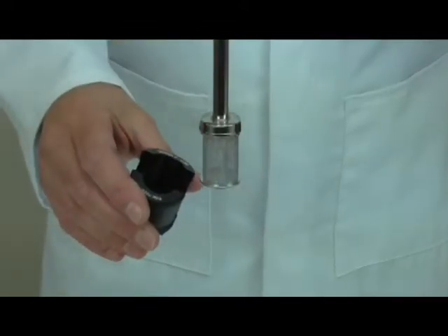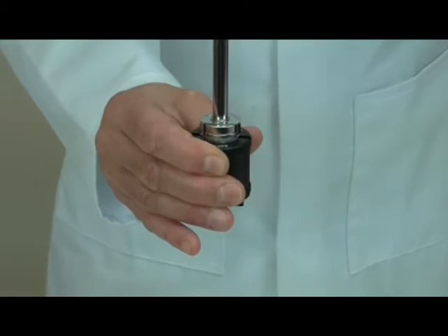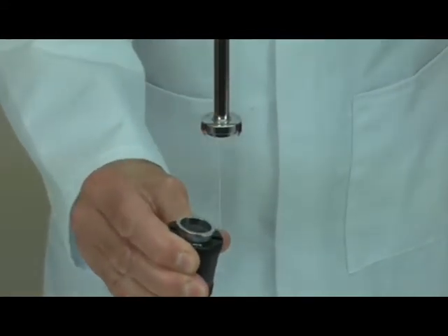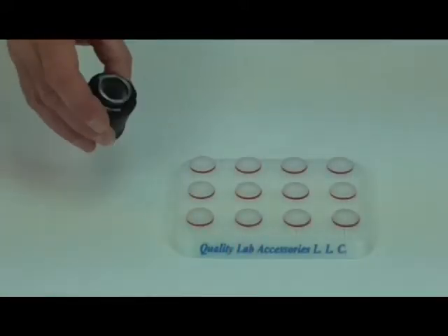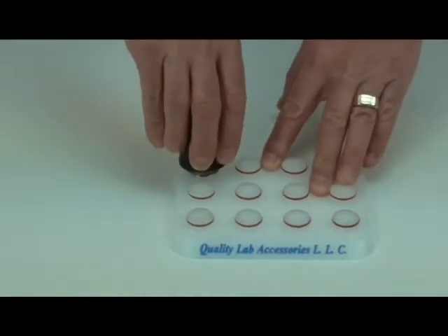out of specification. The new basket tool allows you to take a firm grip on the basket by the bottom rim without touching the mesh at all, and makes handling of the basket extremely simple and easy. When you use the basket holder in conjunction with the basket storage rack, you can reduce handling quite considerably.